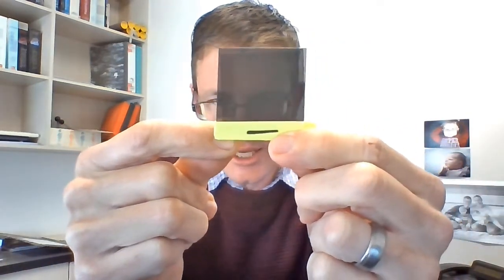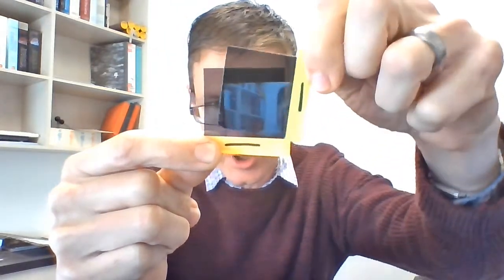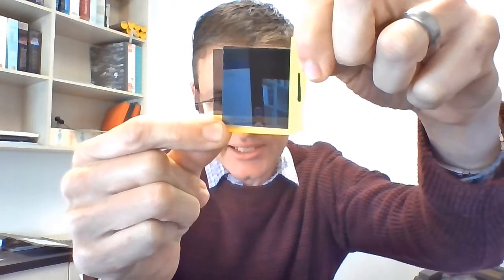Both of these filters are the same, so if we look at them you can see me through them. If I put them together it gets a little darker, but you can still see me. But if I turn them to 90 degrees, I completely shut out the light — because one filter only allows light through horizontally, and the other only allows light in the perpendicular direction, so it stops. Let's use these to do a very interesting experiment and watch this fascinating property of chiral molecules.